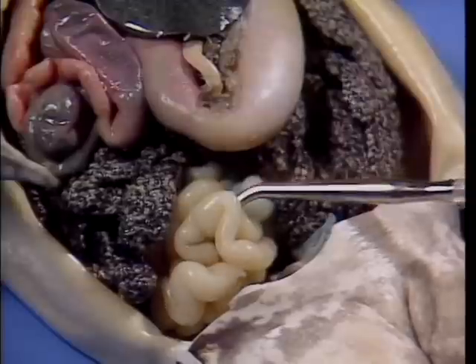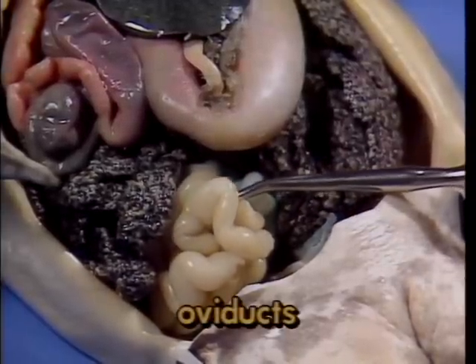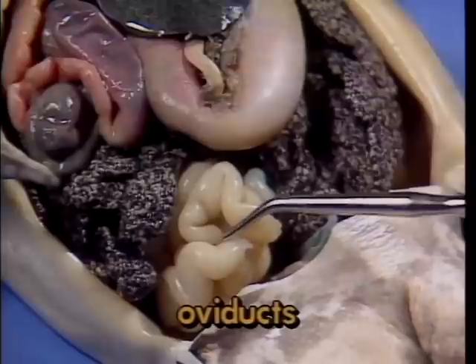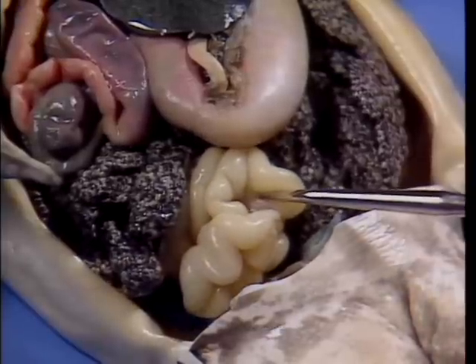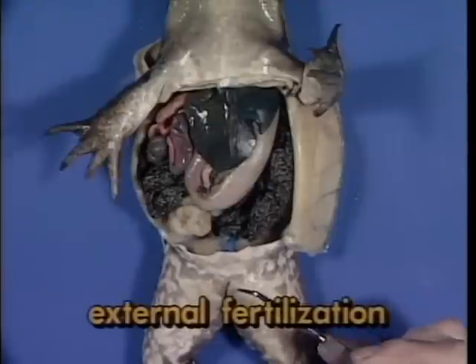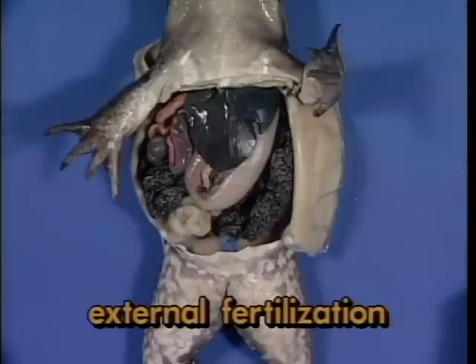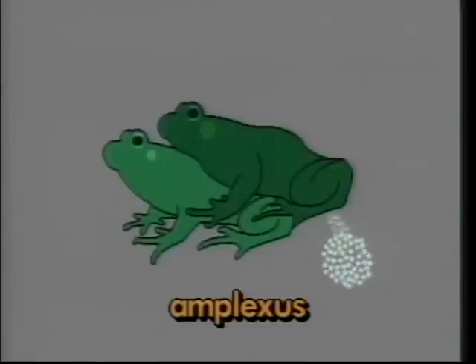Here, underneath the egg mass, is one of the 2 highly folded oviducts. Oviducts transport eggs to the outside of the body by way of the cloaca. The vast majority of frogs have external fertilization, which is accomplished when the male clasps the female in an act called amplexus. During amplexus, the female extrudes eggs, and as she does, the male sheds sperm over them to permit fertilization. The entire process may take hours.